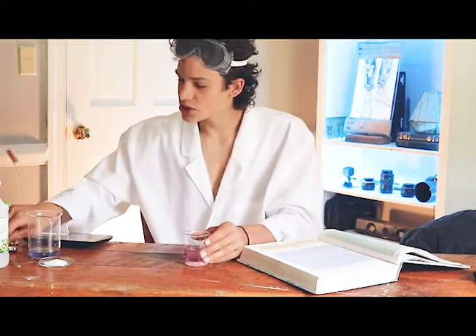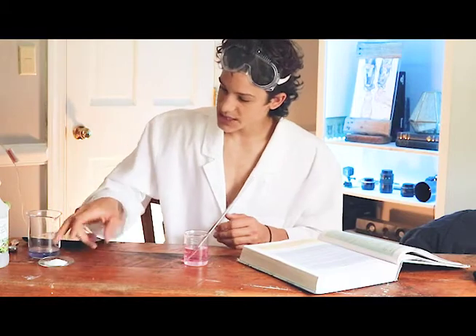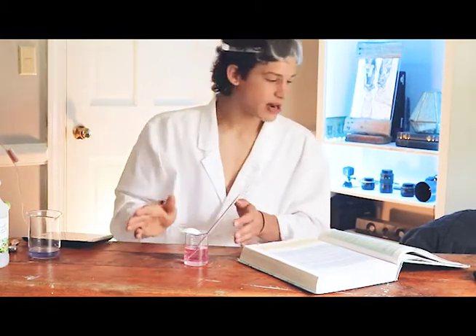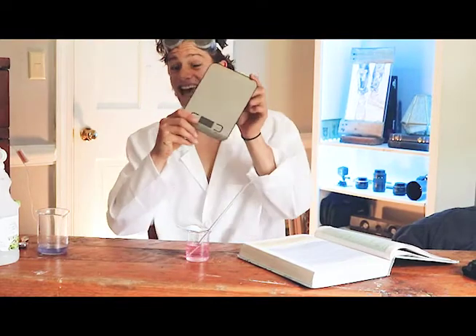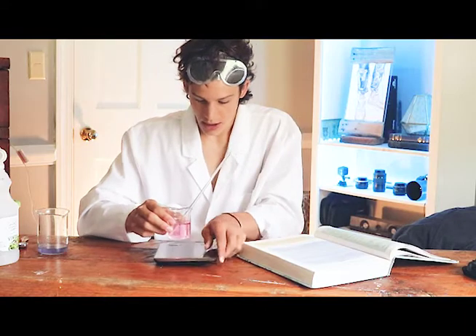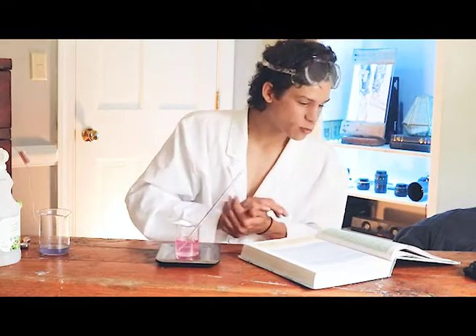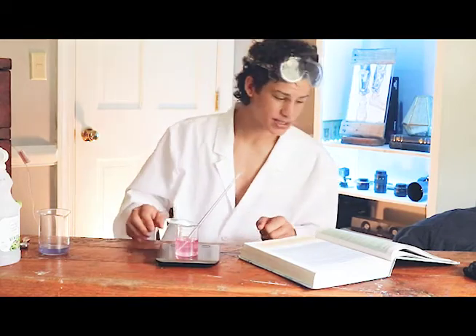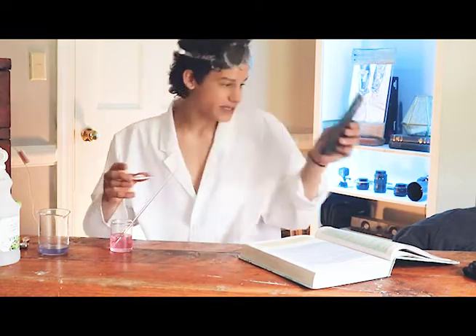Place your stirring rod or spoon into the beaker, then cover it with the watch glass. Now take your scale and set this whole setup on top of the scale. It reads 163 grams — remember that number, 163 grams. Now take the beaker off the scale; don't get rid of it yet, we'll use it later.